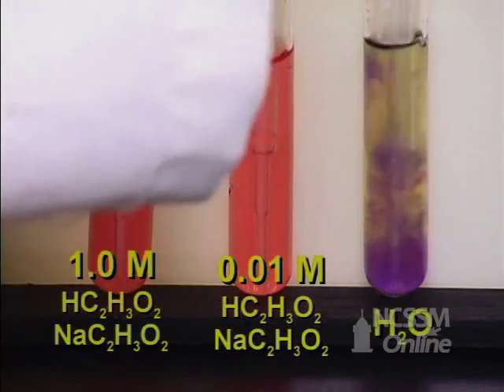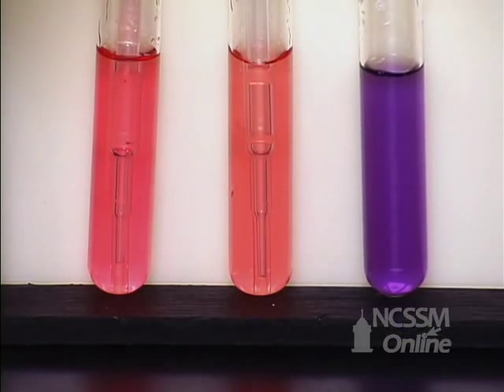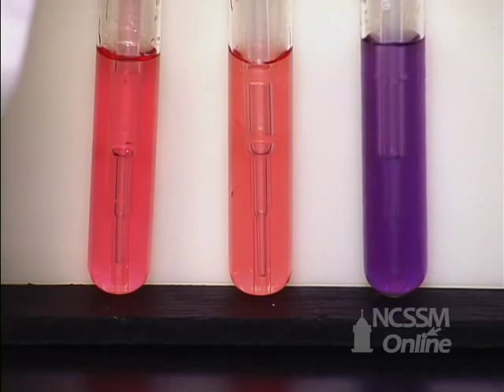But in the water, just one drop has turned it to purple. So this is not a buffered solution. And you can see just one drop of the sodium hydroxide has made this very basic.